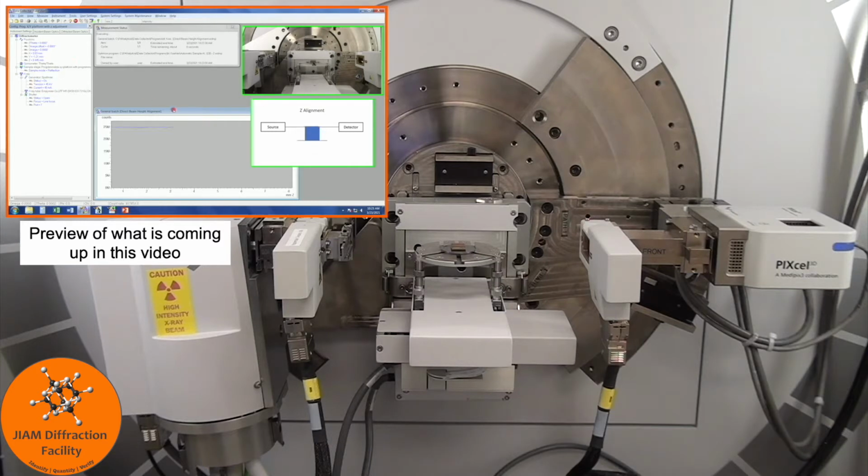This video will show you how to perform a gonio experiment using the XYZ stage. This is the more detailed training video explaining each step. I also have a shorter video linked above that covers only the basics for those who have already been trained but need a reminder on how to perform the measurements.